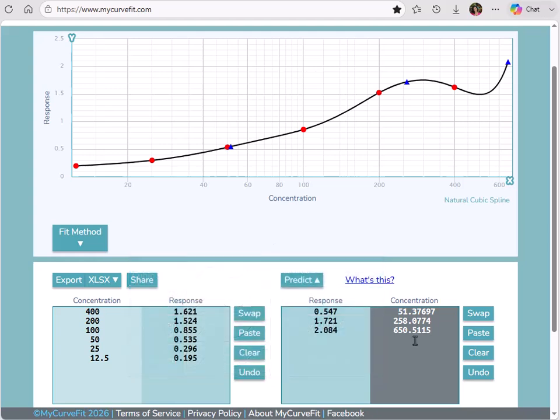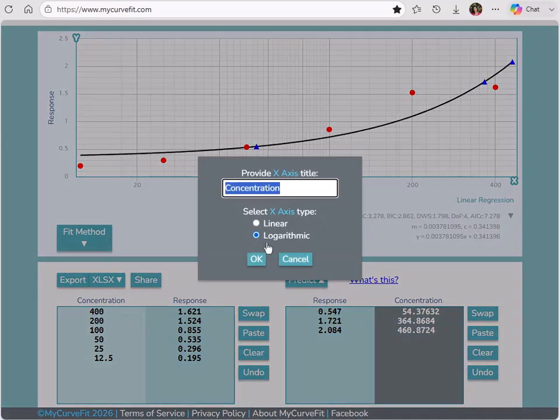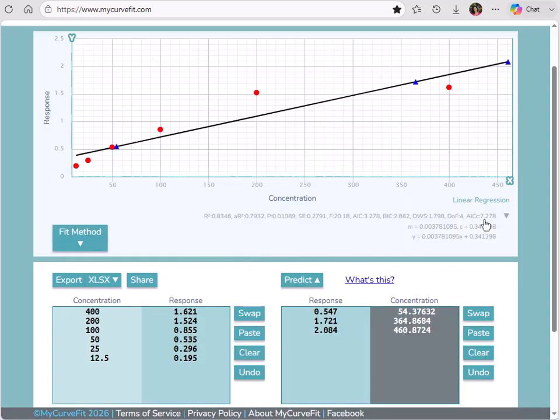This time, both prediction points return calculated concentration values. However, you can see this curve features 2 turning points, showing unstable behavior outside the standard range. Now let's compare this with a linear regression fit. Up to now, we've displayed the data on semilog axes, which is commonly used for dose-response curves because concentration usually spans several orders of magnitude. However, changing the x-axis only affects how the data are displayed. It does not make a sigmoidal relationship linear. To demonstrate a standard linear regression, I'll set the fit method to linear regression and change the x-axis display to linear so that we can see the resulting straight line.